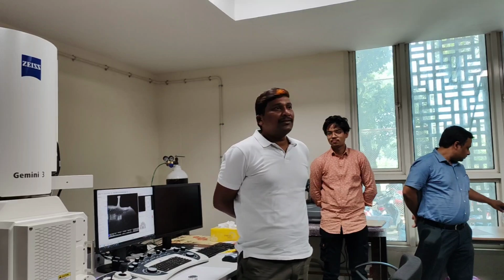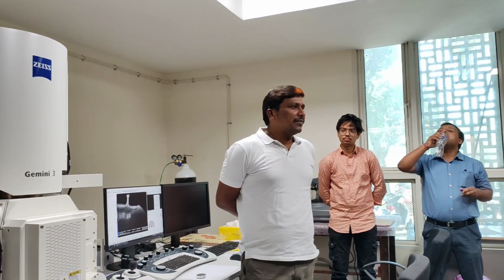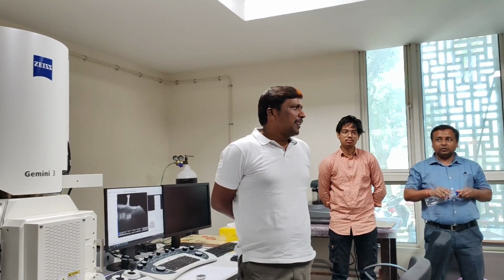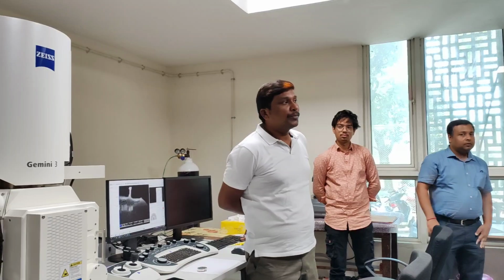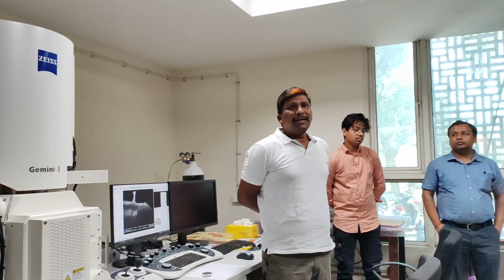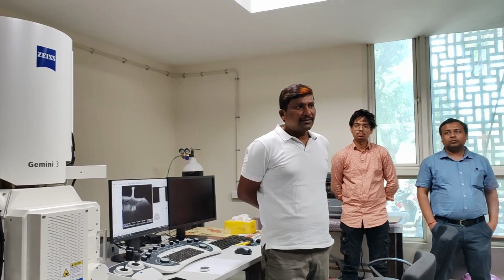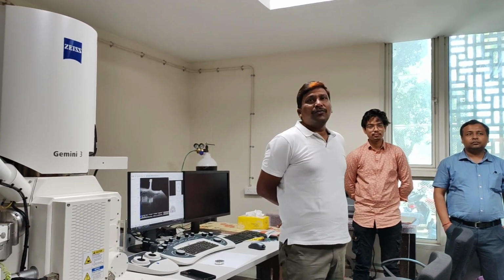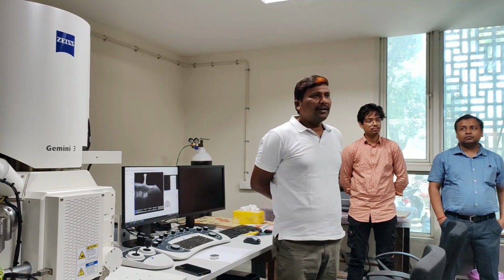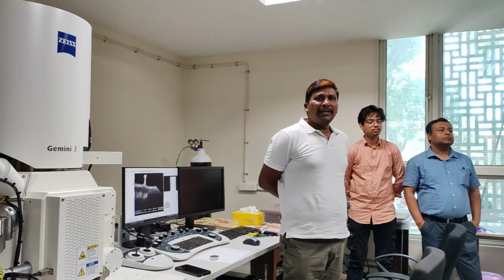So it's a demonstration for the STEM detector only today. All the other parts I think we covered during our last visit. But today we will discuss more on the scanning transmission electron microscope. Hope you have used the STEM as well, for structural information, particles, very narrow particles, right? I want to know whether you are already using it for your research purpose, or is it the first time you are submitting samples?